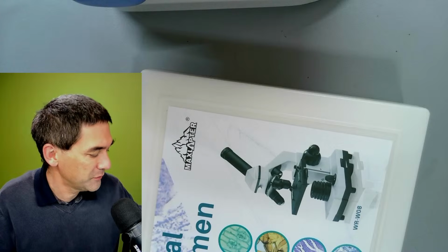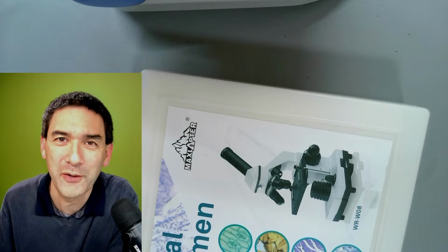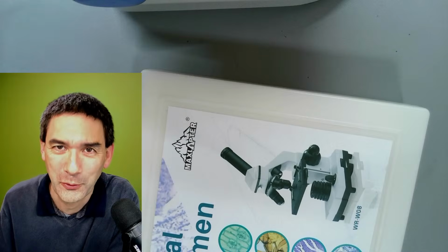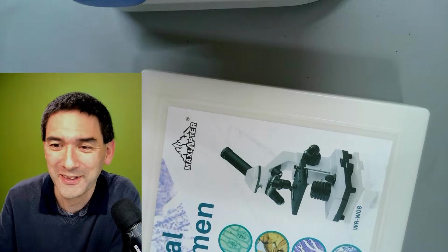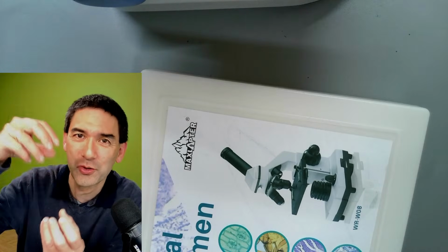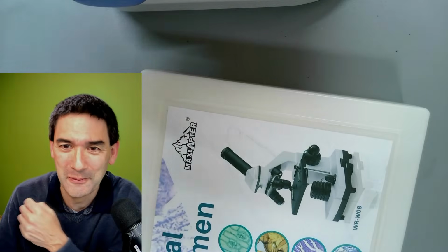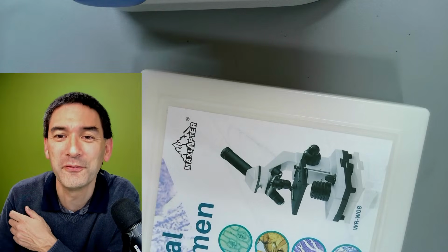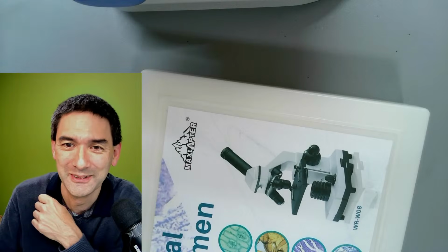Actually, maybe this reminds me of something. A couple of years ago, I made a microscope out of Lego. It's just a tube. I used regular optics. It actually works. Of course, there is no proper focusing. I have to just move the eyepiece in and out a little bit. But it was a very fun project. The whole thing made out of Lego.